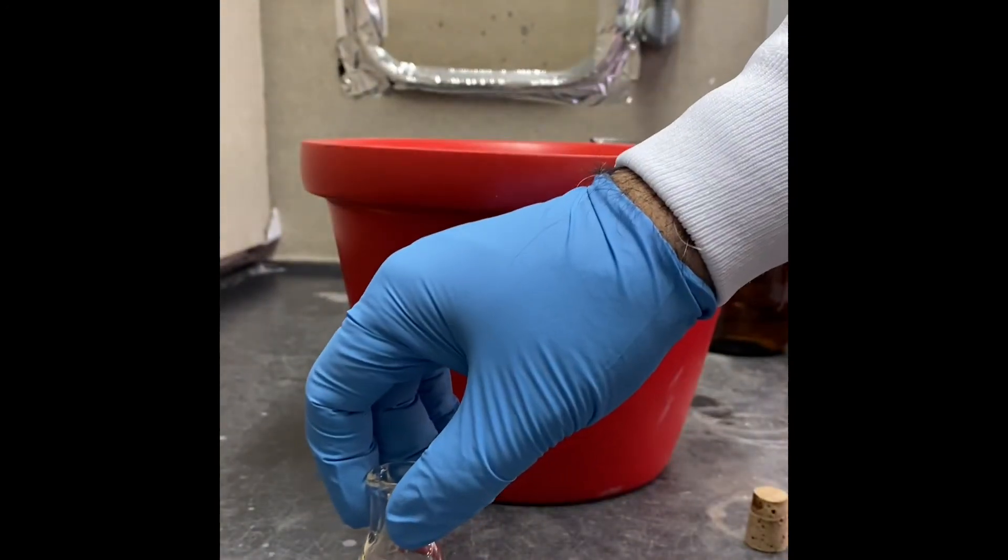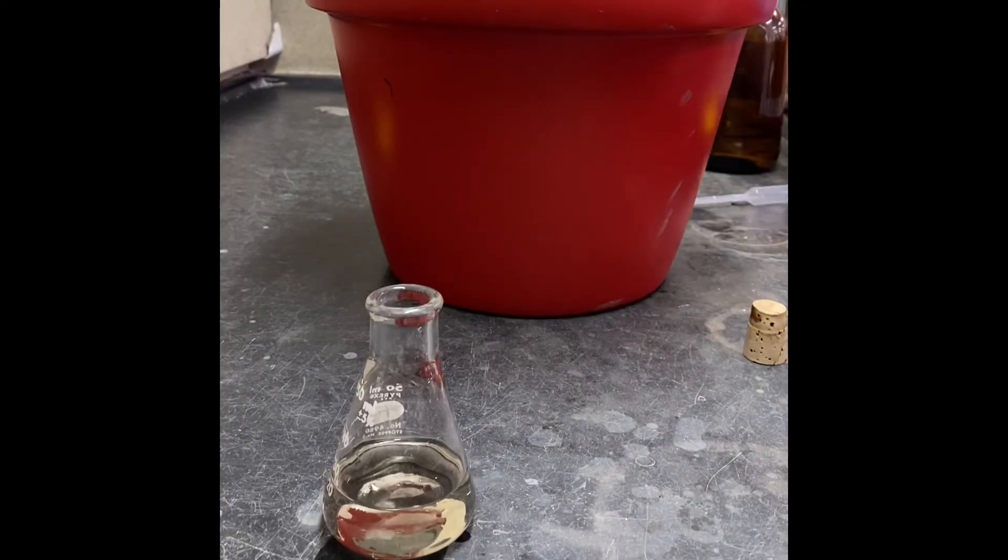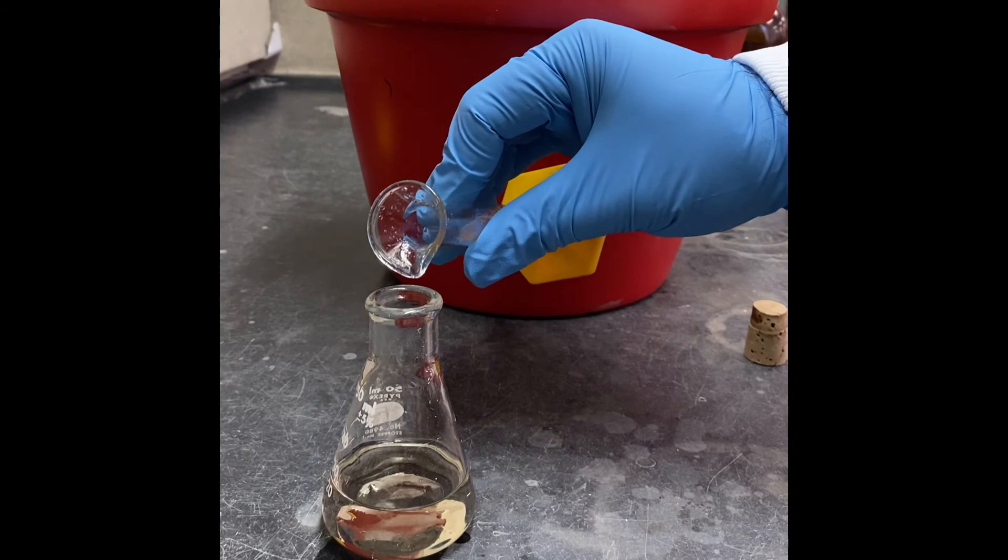Now I'm going to add 7.5 milliliters of benzaldehyde. 7.5 milliliters of benzaldehyde. Ready, now I'm going to pour this.